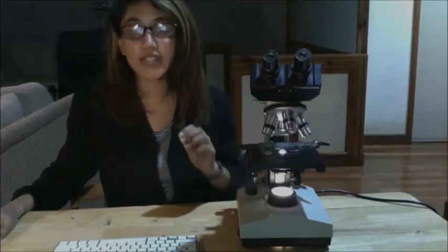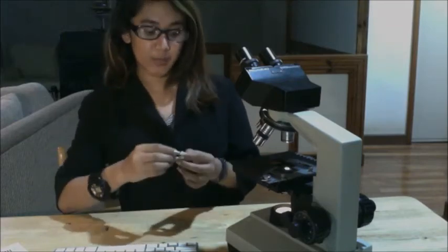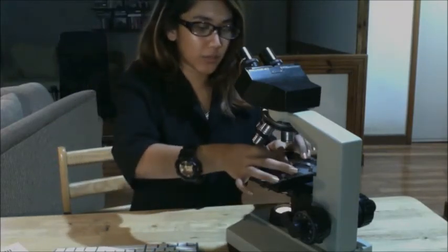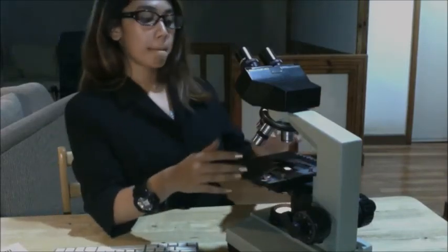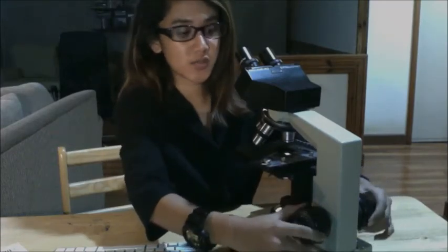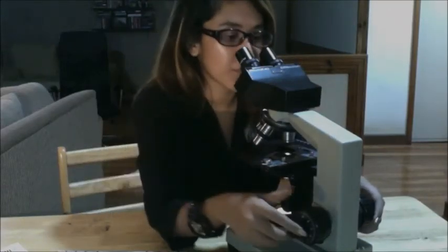Since we don't have any glass slide available, we are going to use a written letter E on a piece of paper. After writing the letter E on a piece of paper, we put it on the stage at the correct orientation of the letter E. Carefully put it on your stage. And then we start to focus it like I demonstrated a while back. You need to lift it at full range, and then look for your specimen or focus your specimen.